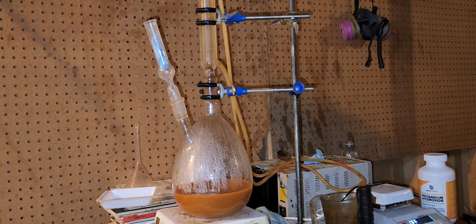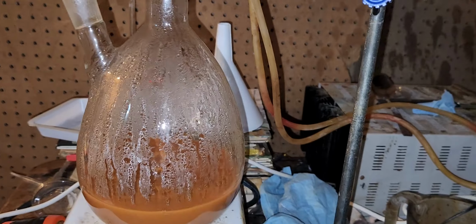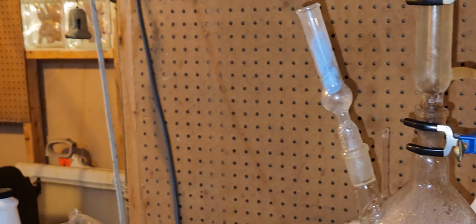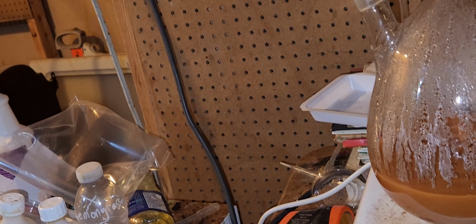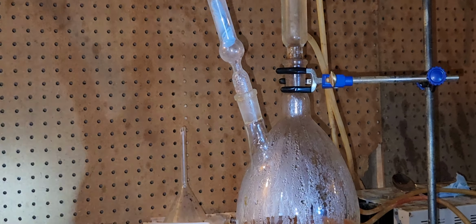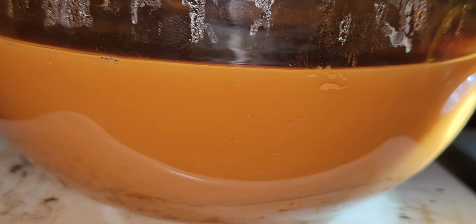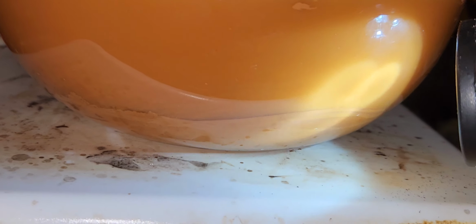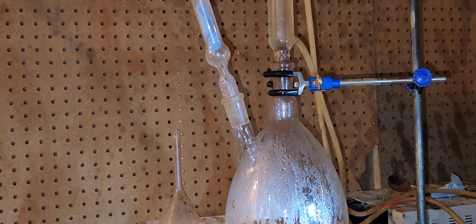Now we can see it's a little bit better. If we get this flashlight and we stir it, first we gotta find it, sorry, it's a little bit harder with this defective hand. Can you see this carefully? Maybe it's very hard to see, but the vanadium compound, some of it's settled on the bottom, but a lot of it is suspended at the top.